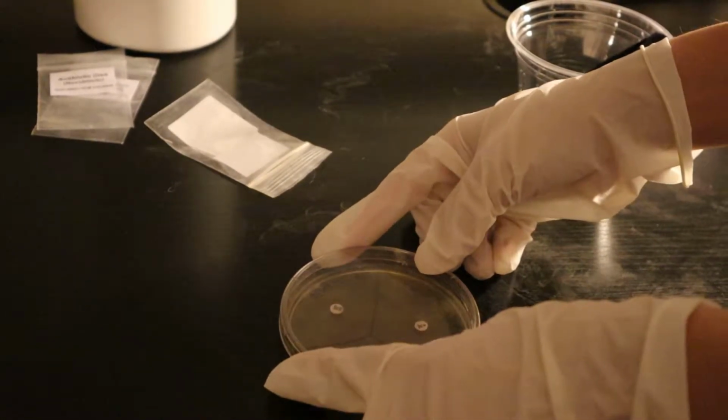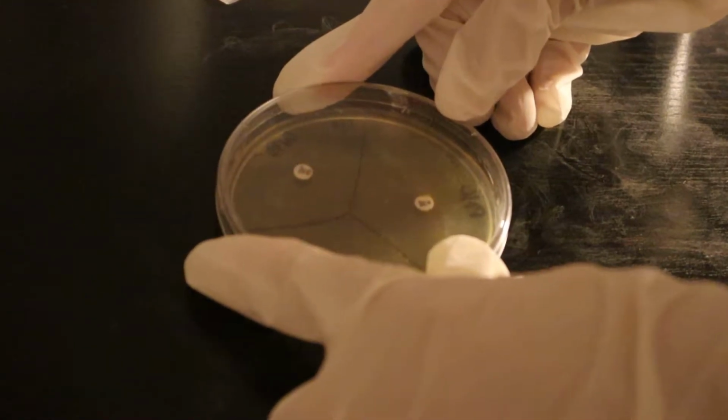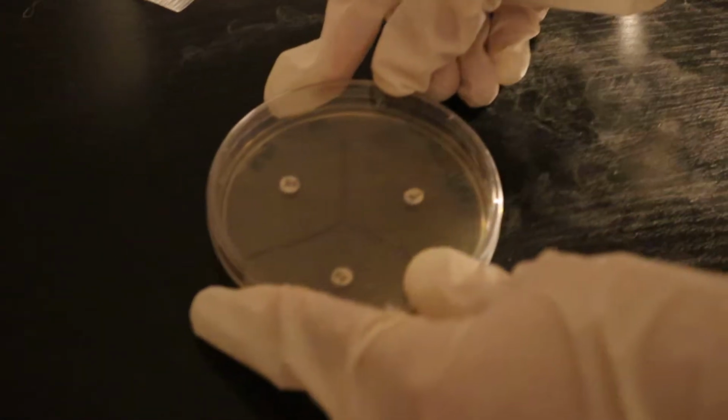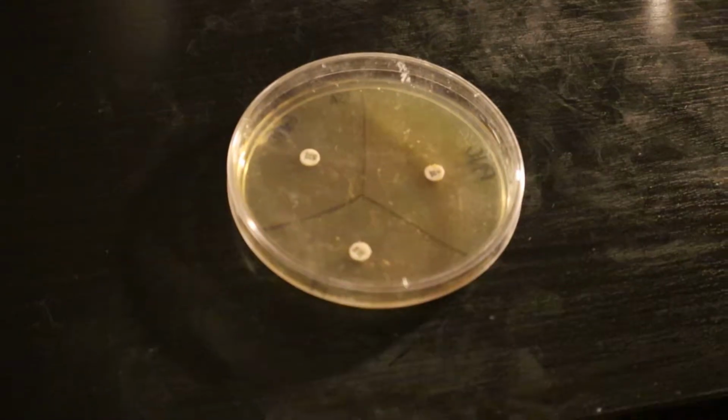I do think that S. epidermidis will be inhibited by novobiocin since it is a bacteriostatic antibiotic which causes an inhibition of growth rather than cell lysis and death.